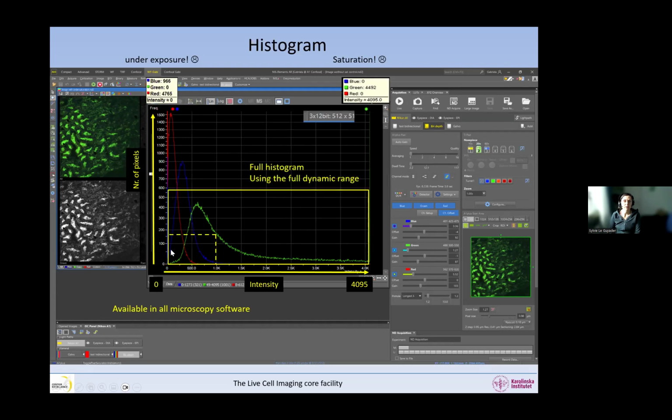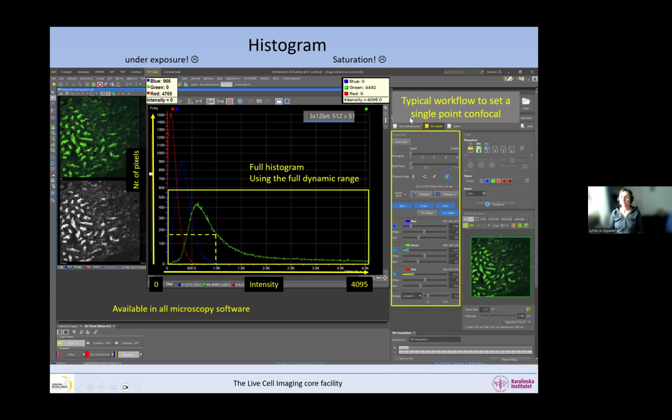And here with the green, I have quite a good full histogram. I'm using the full dynamic range here, so I'm filling up the histogram and stretching. So the green is better than the others, but it's anyway saturated. So we have to do something for all these channels, basically. And so these are the settings, and we will go through all these settings in this typical workflow on how to set a single point confocal this afternoon.